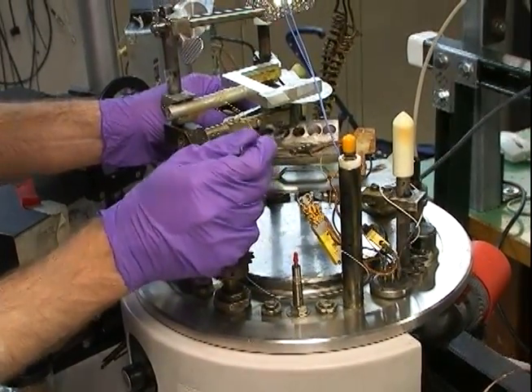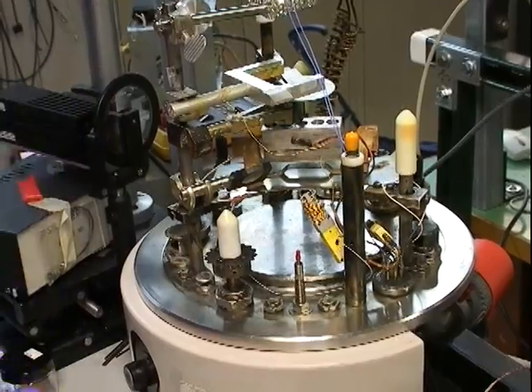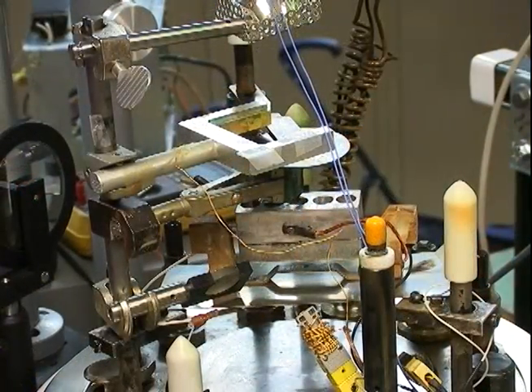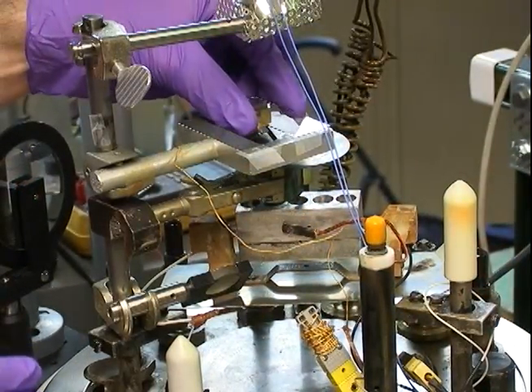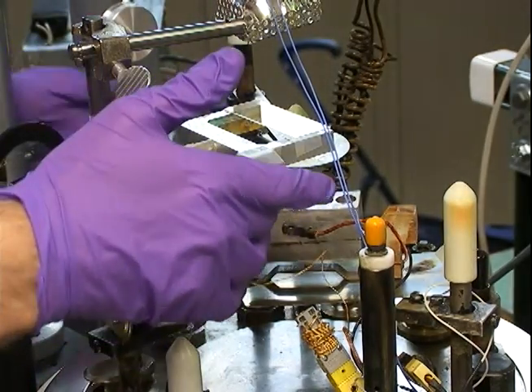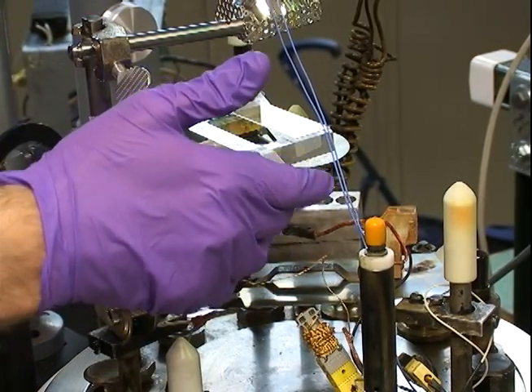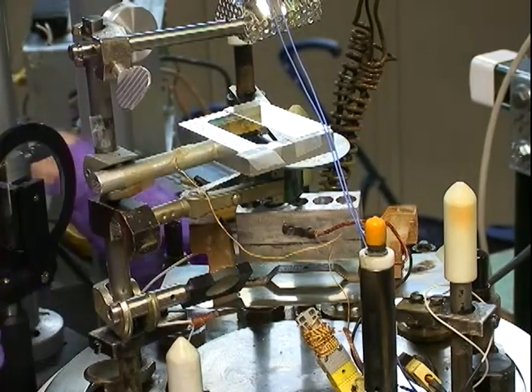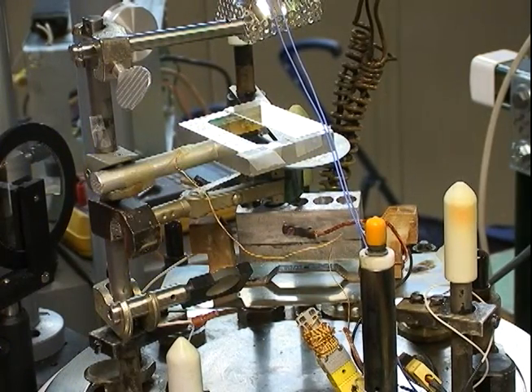Now that the sample holder has been loaded, a glass slide is placed on top into the substrate holder. This glass slide was cleaned using acetone and IPA.